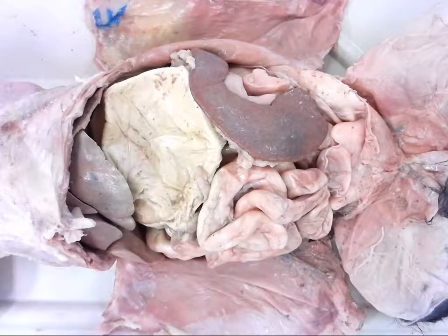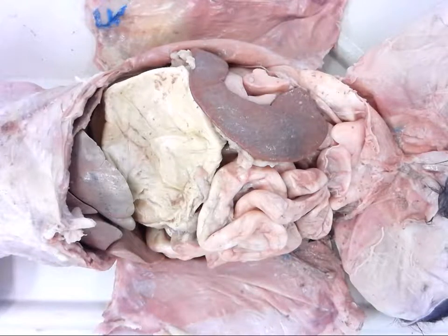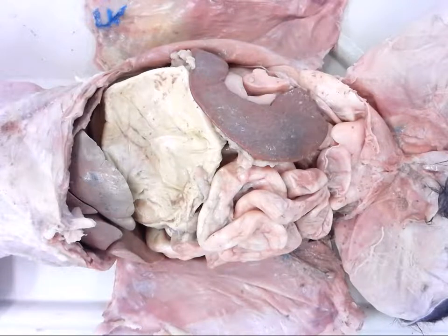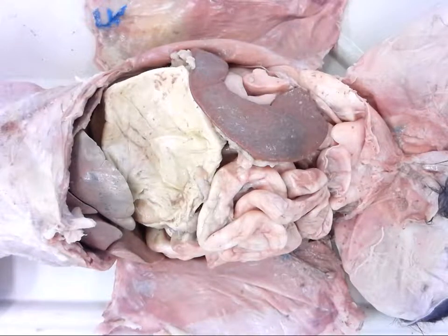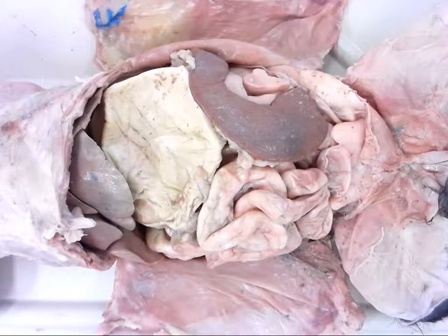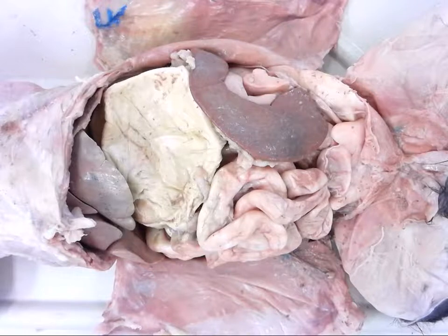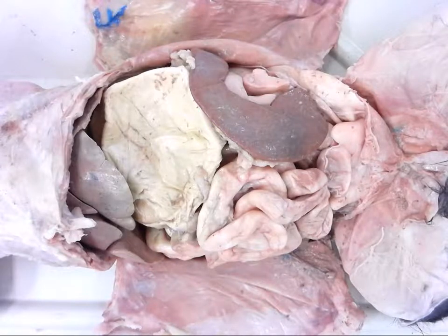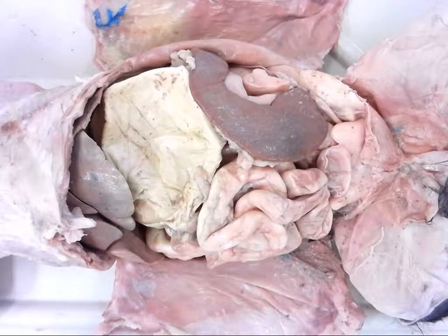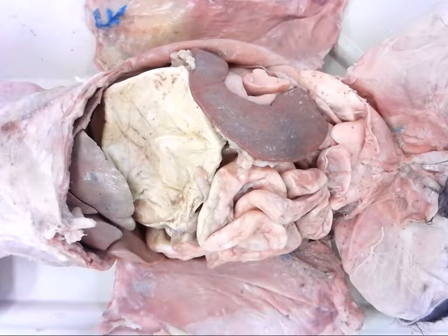In this video we're going to be taking a closer look at the abdominal cavity — a quick overview and then looking mostly at the digestive tract. Once we remove the greater omentum we can see all of the abdominal contents, which includes mostly the stomach, spleen, small intestine, and a little bit of the liver. I'll go through some of those accessory organs in another video.